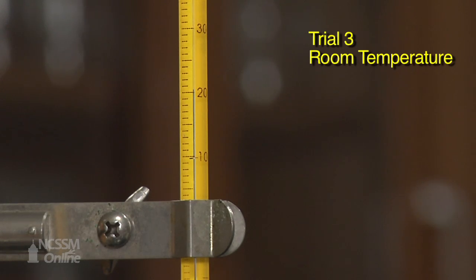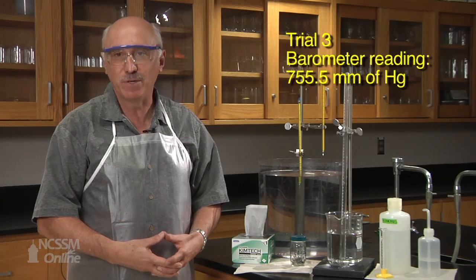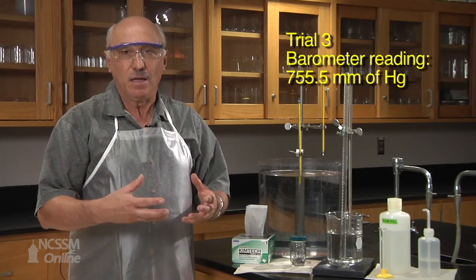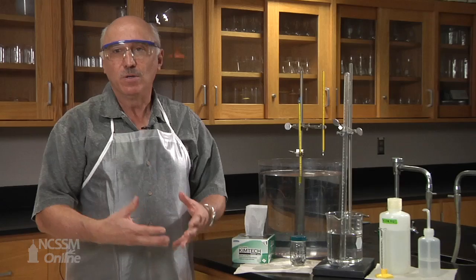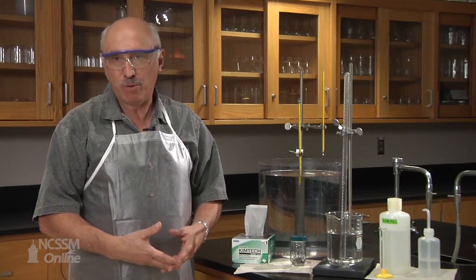The atmospheric pressure for trial three is 755.5 millimeters of mercury. We have completed the lab now. Refer to the lab template provided and produce your lab report.